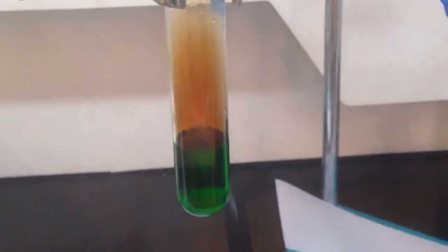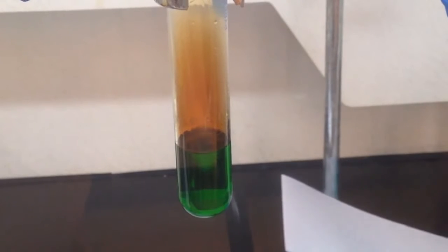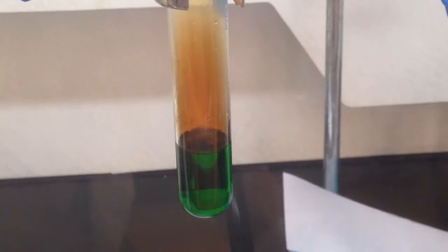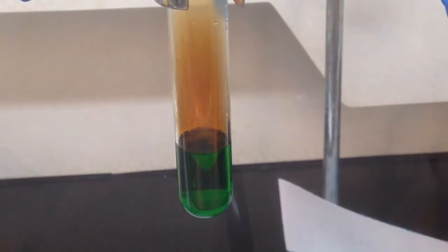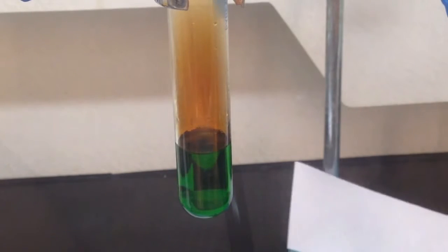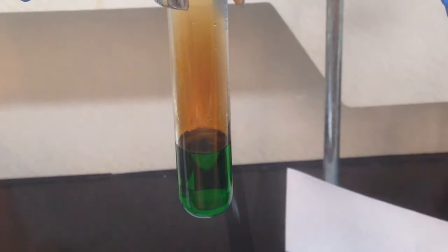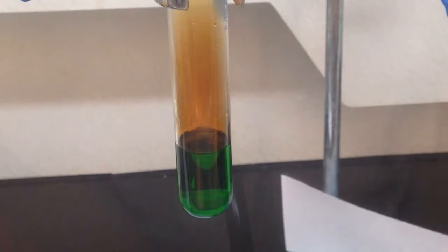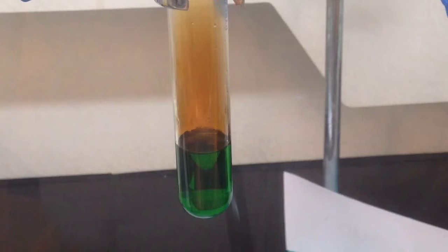The green color comes from the ions of copper. As we know, copper 2 ion can give us green or blue color. But this one is rather interesting. Most of the time, copper 2 ions are blue, but when they are coordinated tightly with nitrate ion or some other ions, they will give us a very beautiful green color.